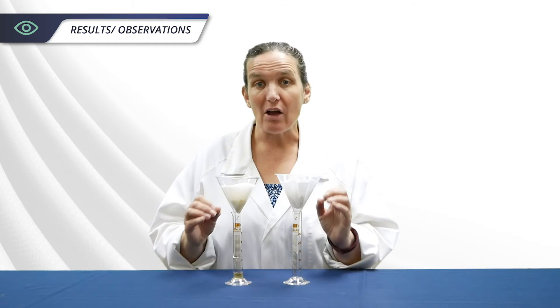You can have your students calculate the number of mils they get per gram of apple. And if you collate the class results, you can calculate the average and variance as well.